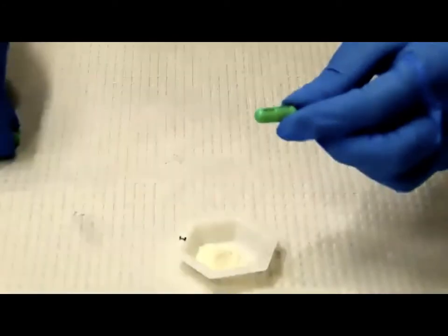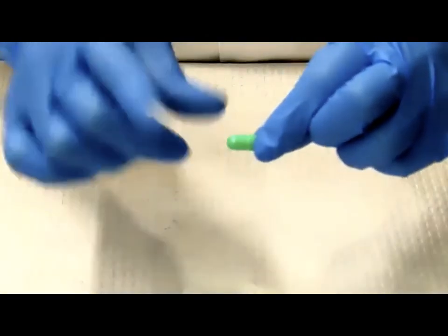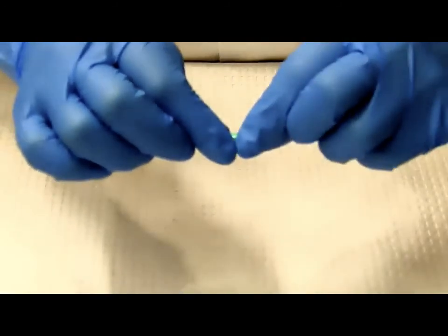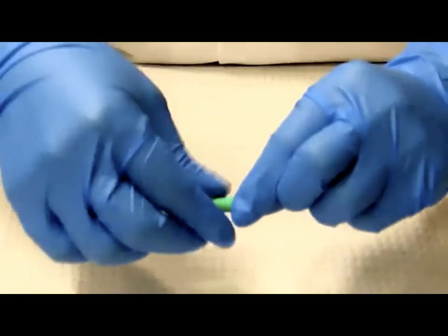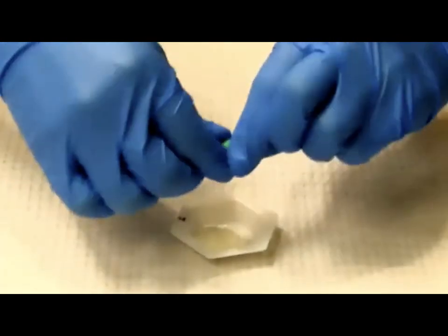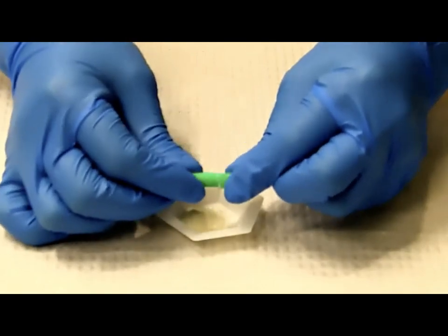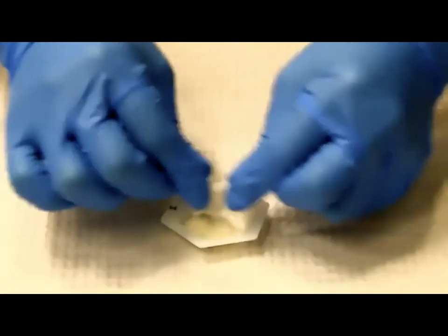So that's good. Let me do one more slow-down process. One finger holds on to where the lock is and one finger holds on to the capsule body. This finger should be squeezing gently. These 2 fingers should twist and pull at the same time. You will feel the unlock, and as soon as it's unlocked, you can pull them apart and gently get all the powders out. Tap, make sure everything is out, double check, and then you move on to the last one.